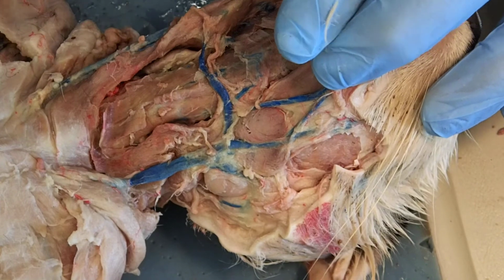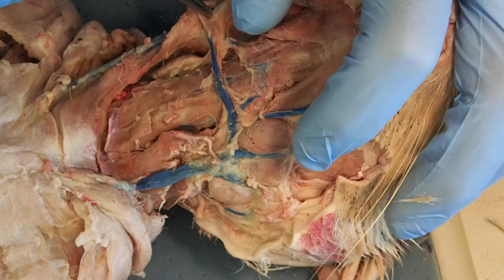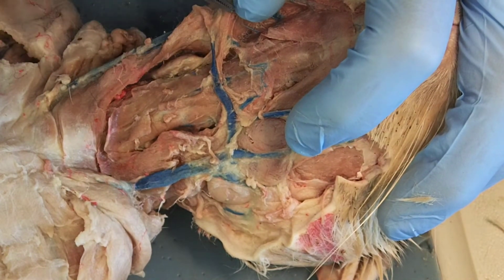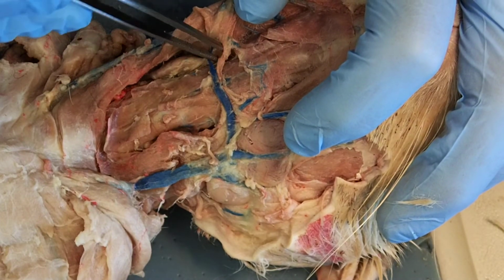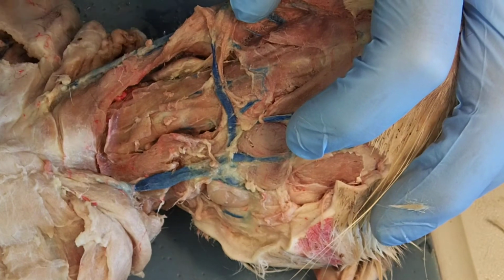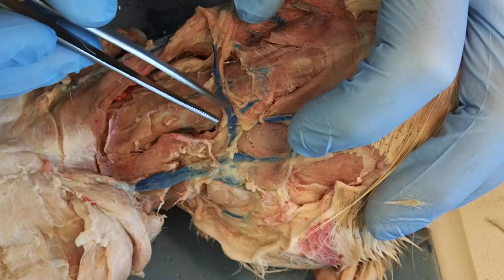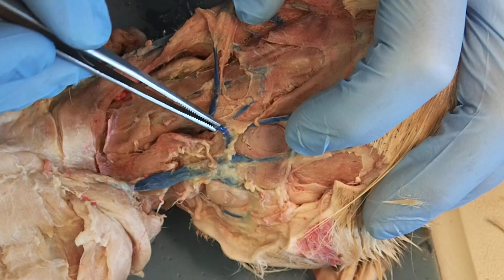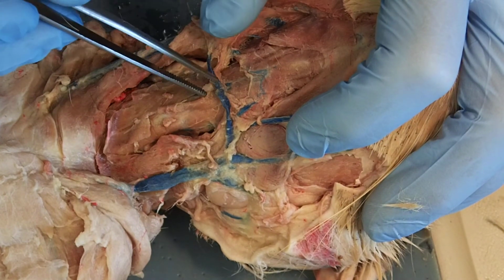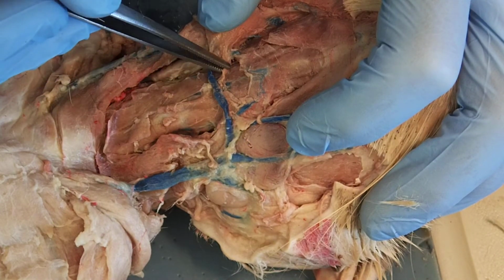On this lateral side of the skull is a styloid process. This is my stylohyoid. It's running to the hyoid, and it's coming from that styloid process. This is my stylohyoid. We're going to use that root word stylo again in just a little bit. If I look over here, if I were to clean it up, and this one's so easy to break off, so I've kind of left it alone for the most part once I found it over here, but would be my other stylohyoid. Stylohyoid.